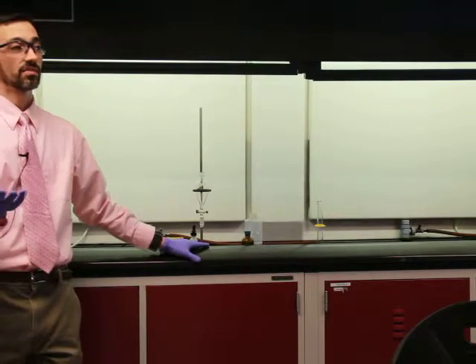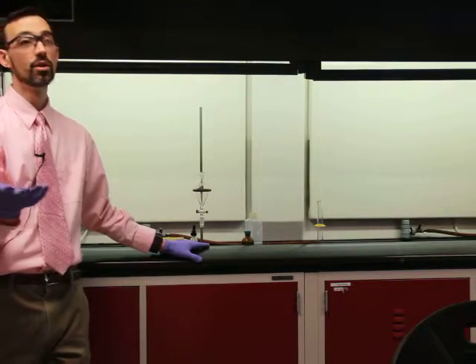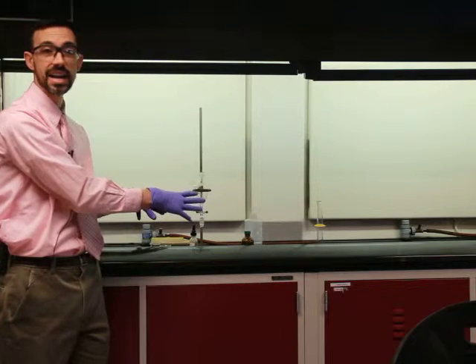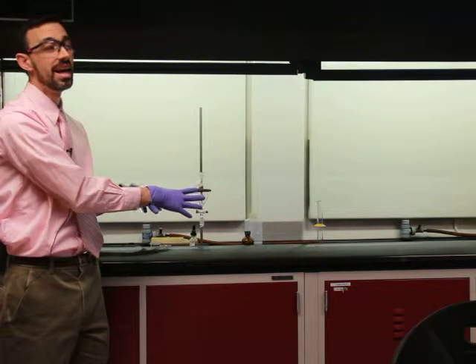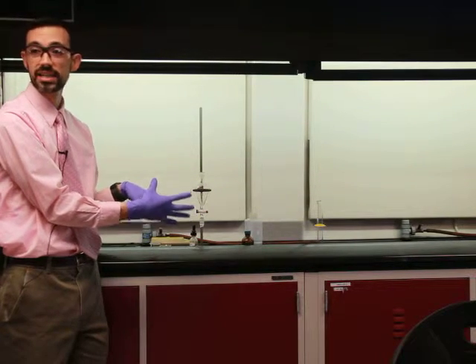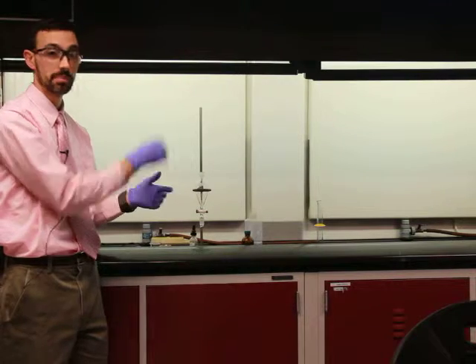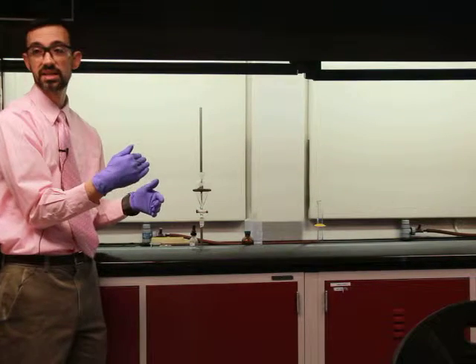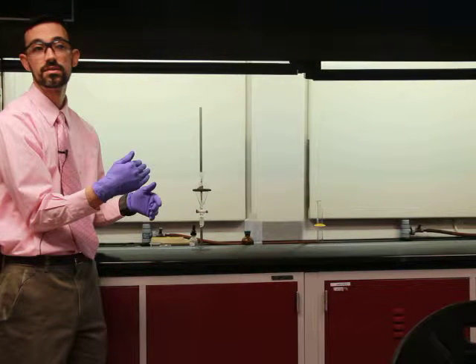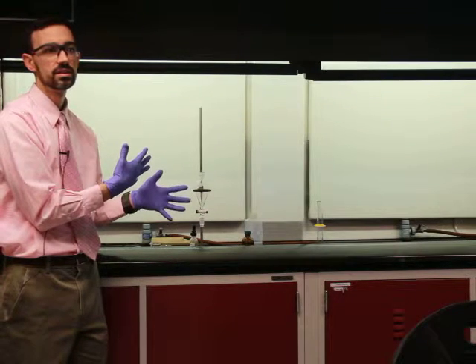We could just come to class on Friday at the normal time to take our quiz, and that'll be all we need to do. But on Friday, you would have come back and found your 2 samples dried out, and you would have weighed them to figure out the masses that you recovered. Then you would have scraped some out and taken a melting point to compare it to the knowns that potentially were used in this experiment. All right? Any questions on the technique or anything?